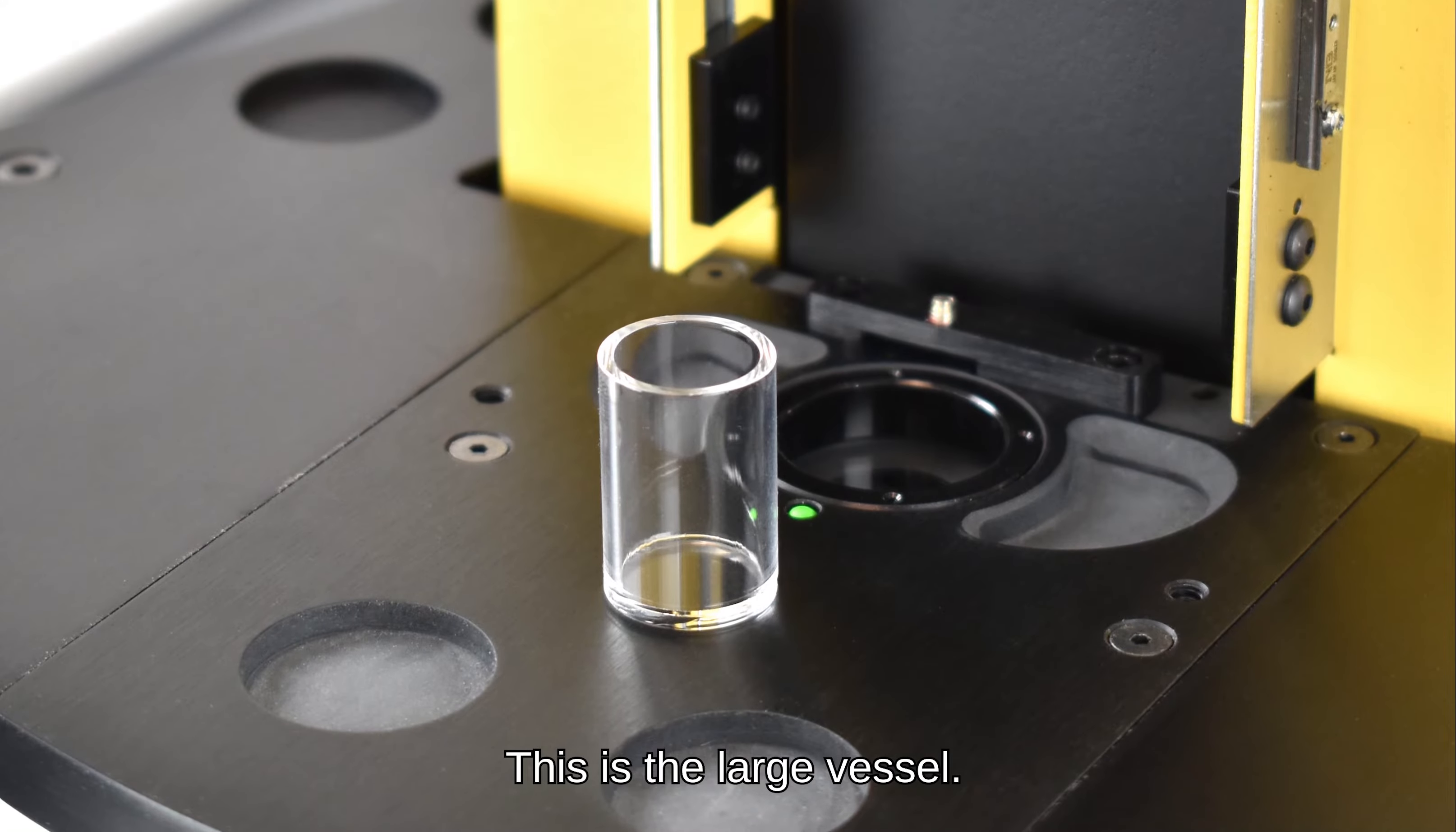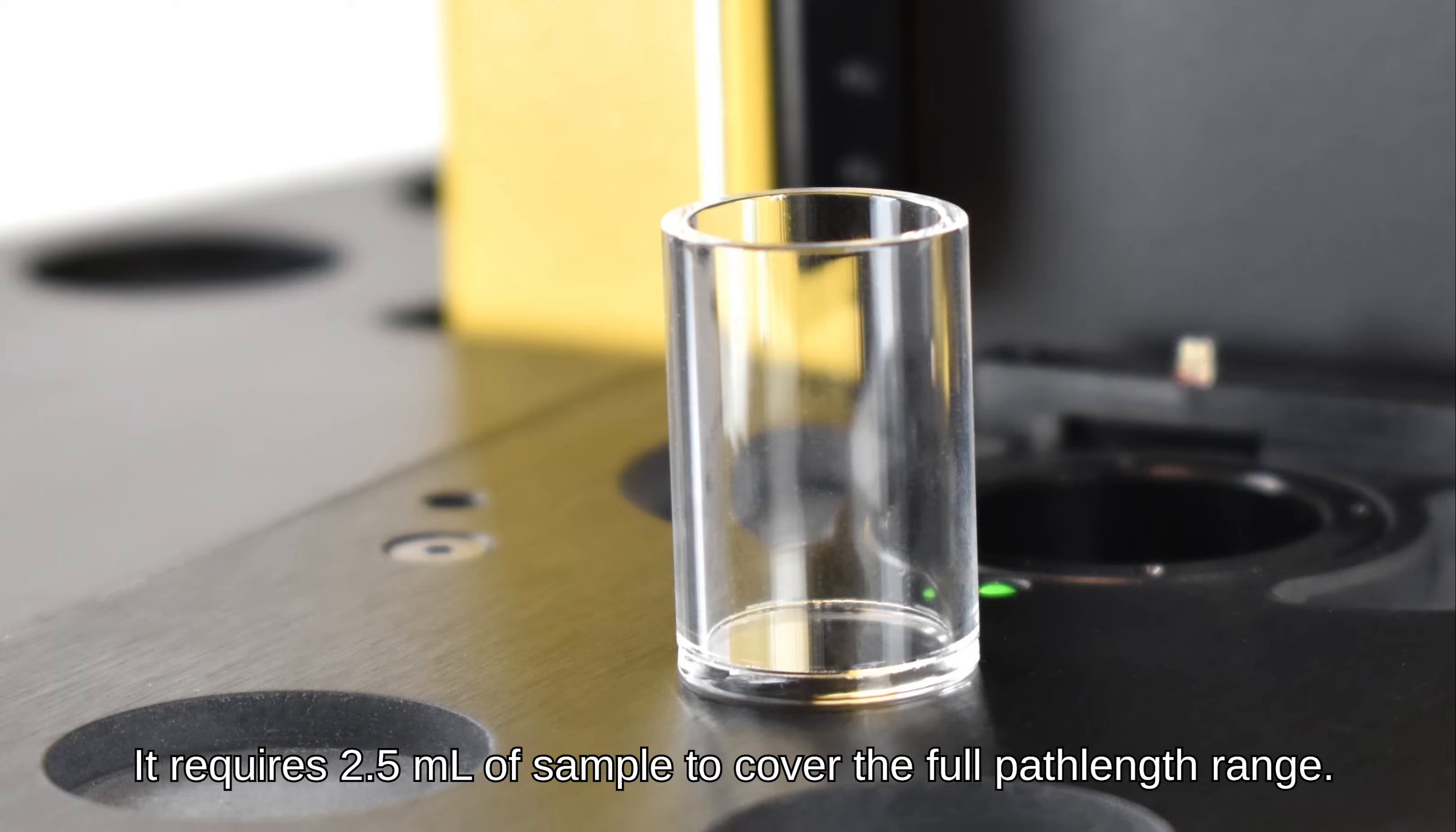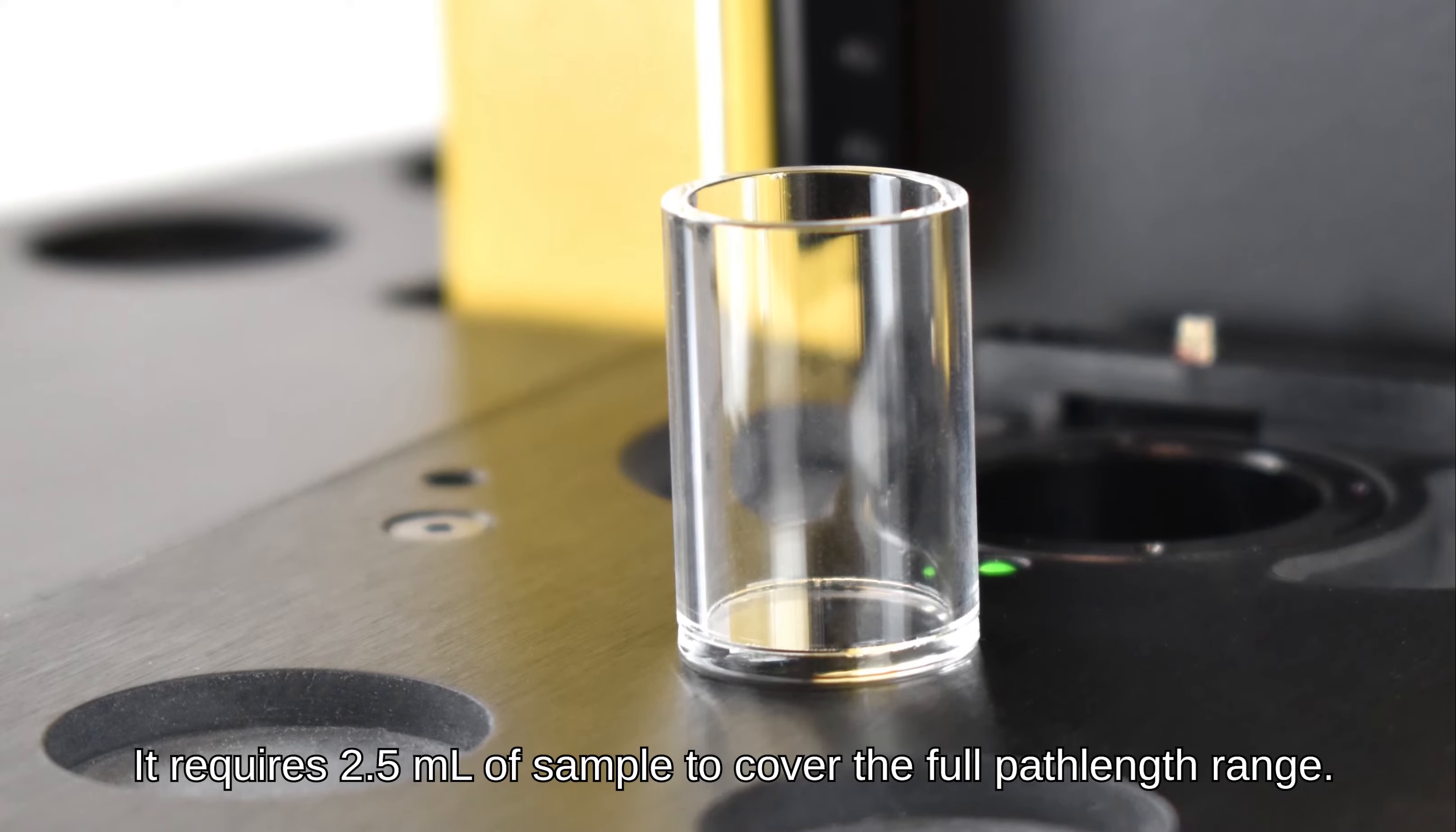This is the large vessel. It requires 2.5 milliliters of sample to cover the full path length range.